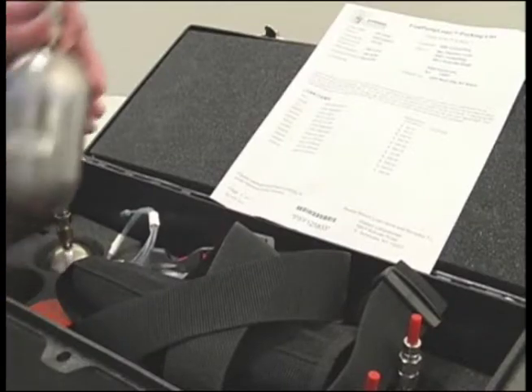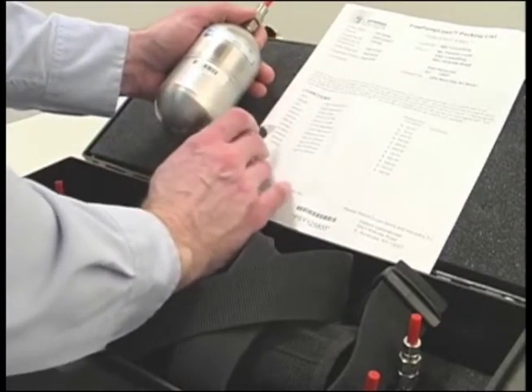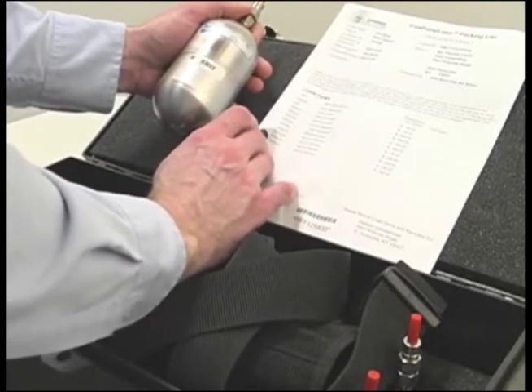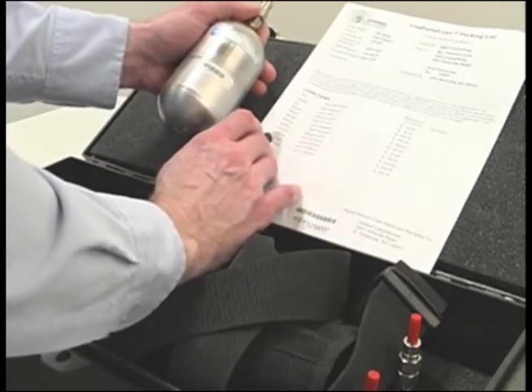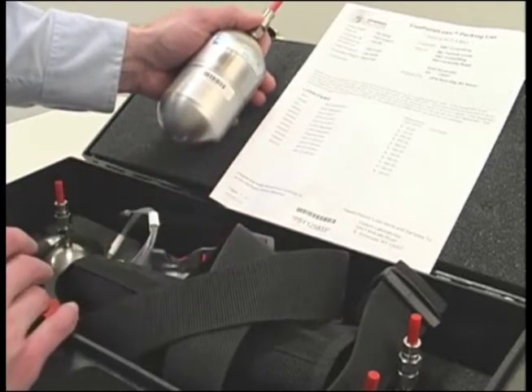When receiving your order, verify that you received everything you requested. Match up the packing list to the contents of the package or packages to what you requested. You should have received the correct number of cans and regulators grab connectors.